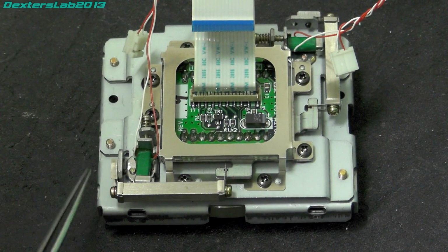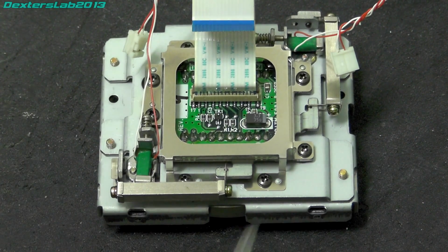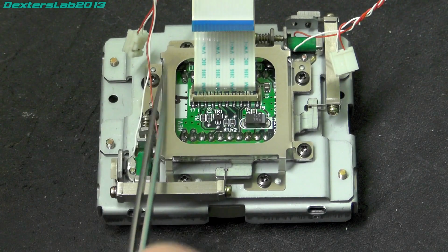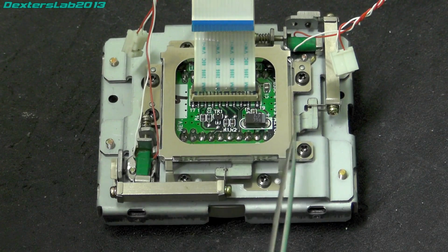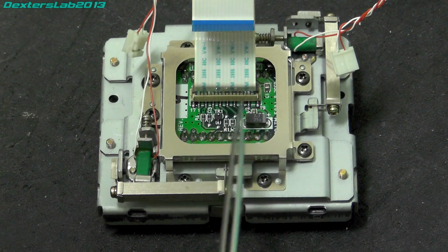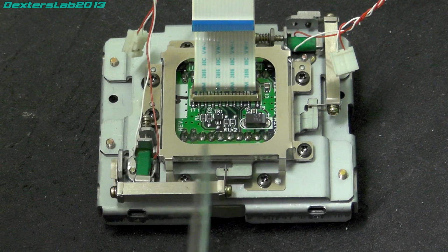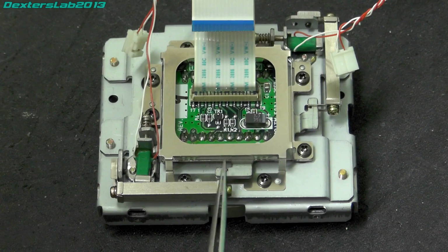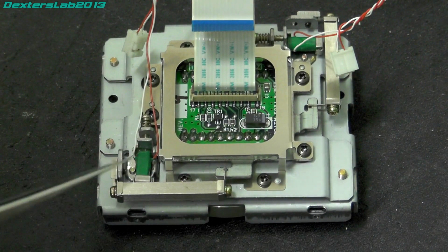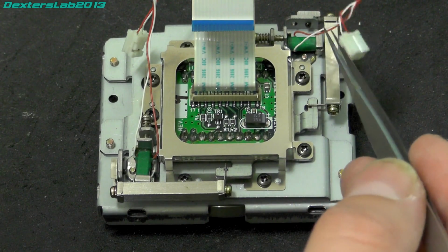We have this pressed steel mounting base, which the C-mount adapter is mounted on, that's underneath. Other base here, we have this other structure, which looks to be made mostly out of thin stainless steel. And then the CCD mount is mounted on a steel plate, which is then mounted on the stainless steel structure. So we've got two actuators here. We've got one here, this thing in green, and we've got another one up there with just two wires going to each one.